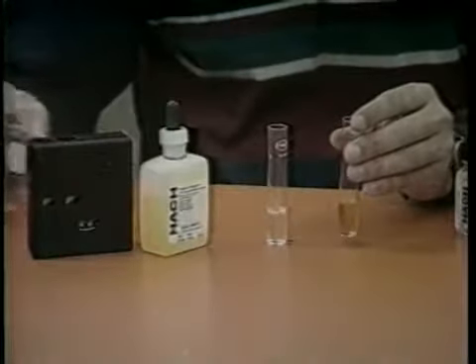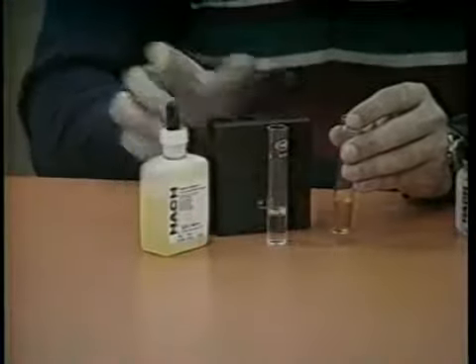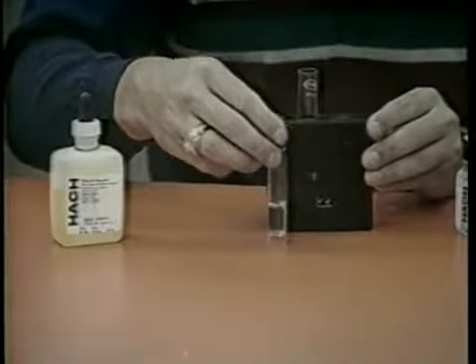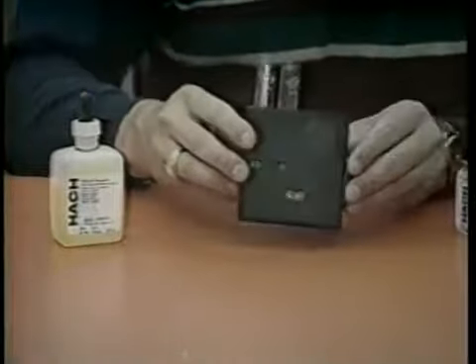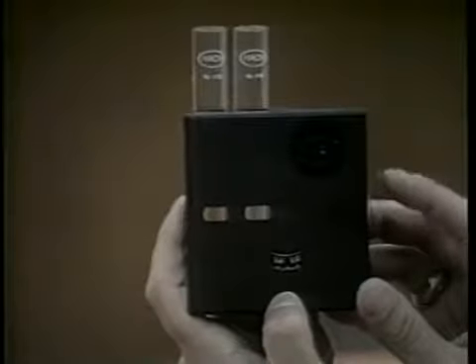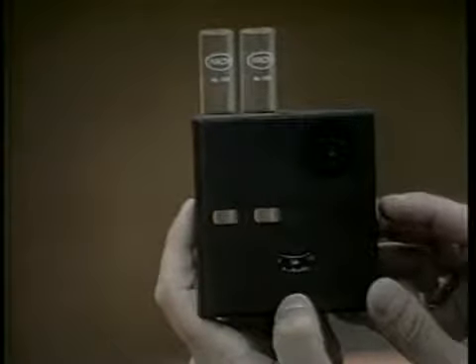If ammonia is present, a yellow color will be evident. Insert the tube, which contains Nessler's reagent, into the opening on the right side of the color comparator. Insert the other tube containing untreated sample into the left opening. This tube cancels out any color resulting from the pond. Hold the comparator up to the light source and rotate the disc to obtain a color match. Read the disc to obtain the milligrams per liter total ammonia nitrogen.